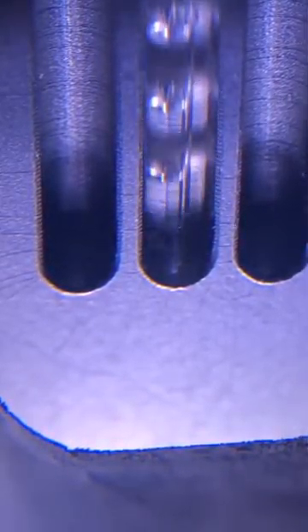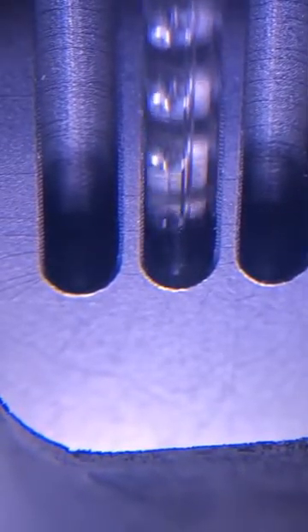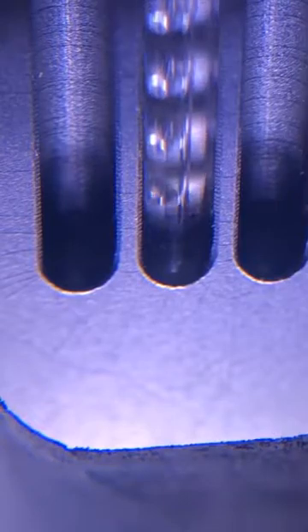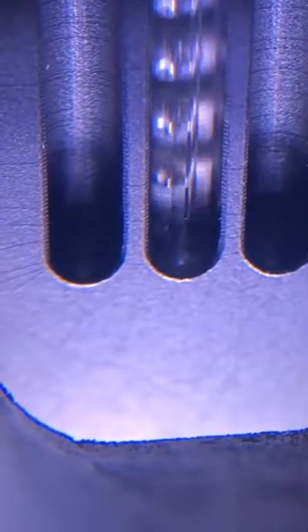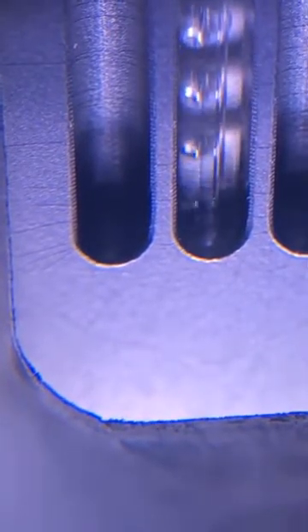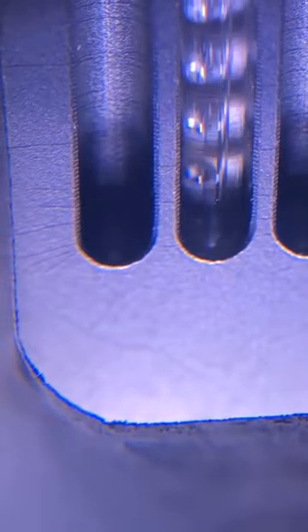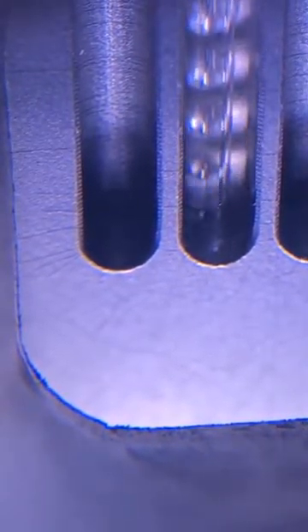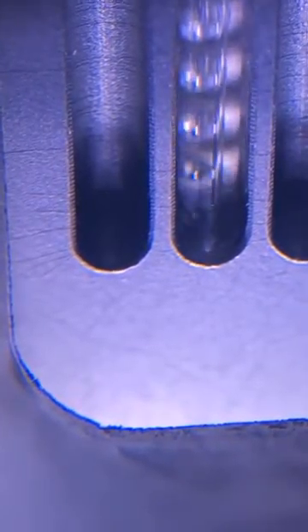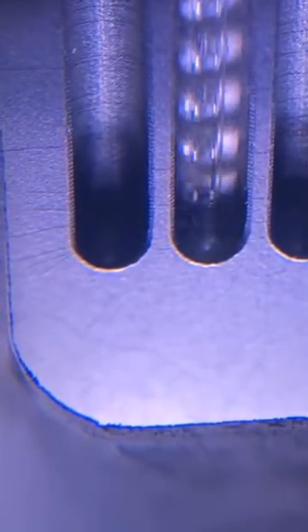Okay, we're at 109, 110. It should pick up here in a second. 110.9. 111. This is actually the boiling point now. You'll see what's happening here in a second. 111.4. Now it's going to start going really fast.